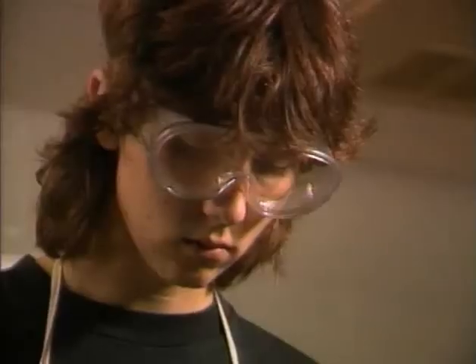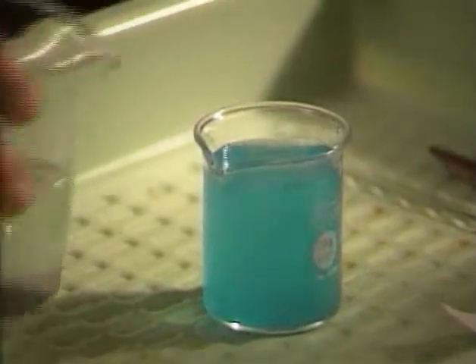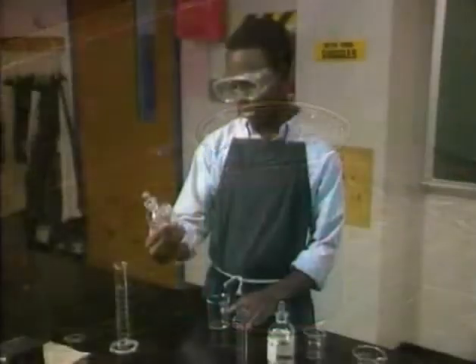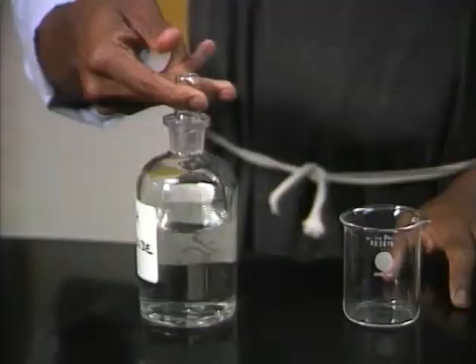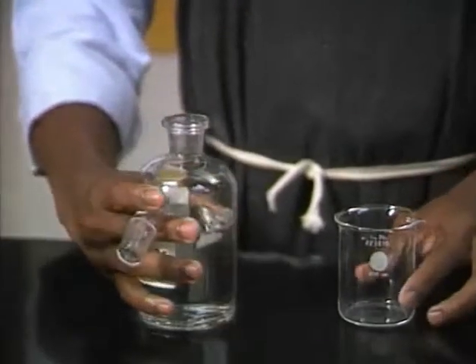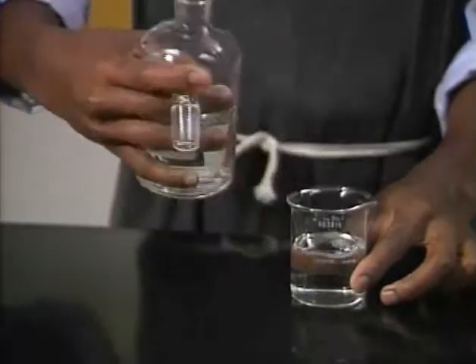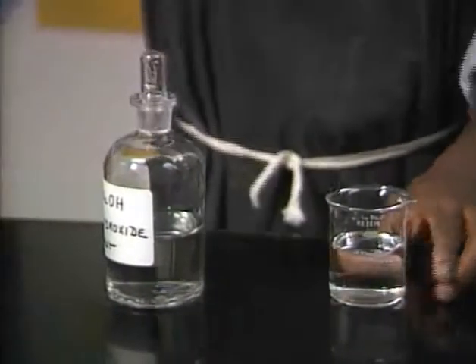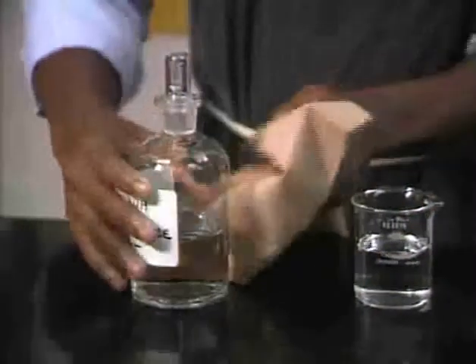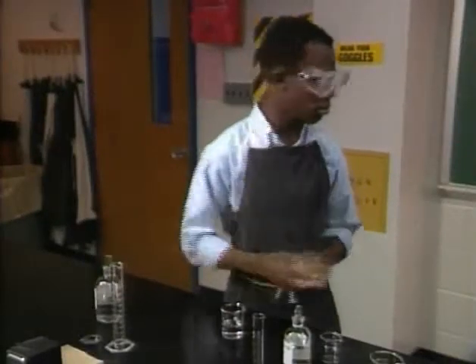Whenever you work with chemicals, there's a chance of spills. A work tray under your setup will help contain them. Always move carefully when handling chemicals. Keep coin-top stoppers between your fingers, not on the bench where they can pick up contaminants. Hold bottles with your hand over the label and replace stoppers immediately — covering the label keeps drips from blurring it or getting on your hands.